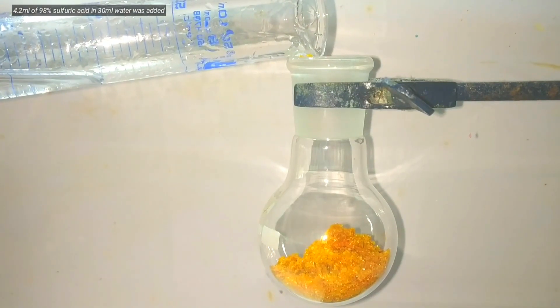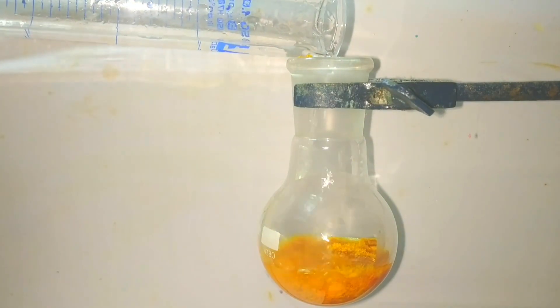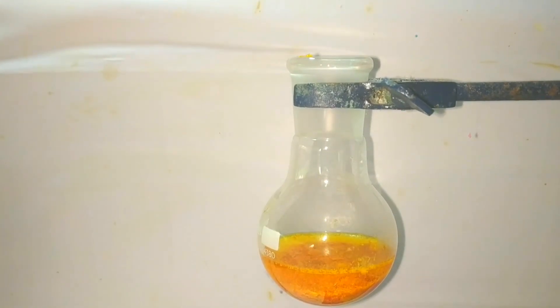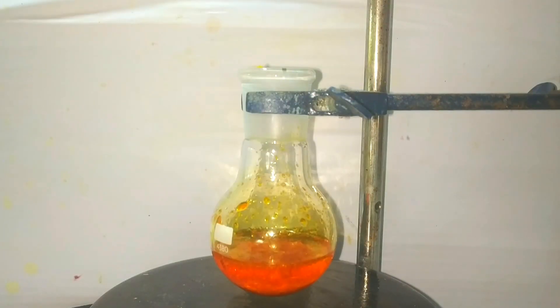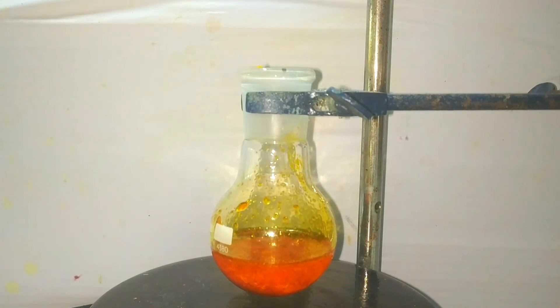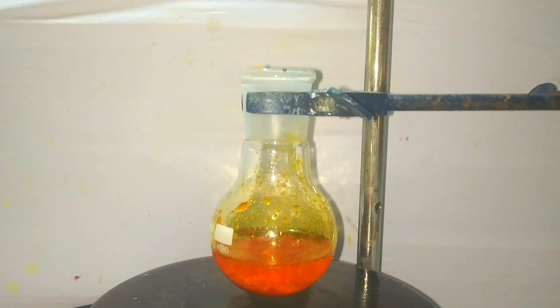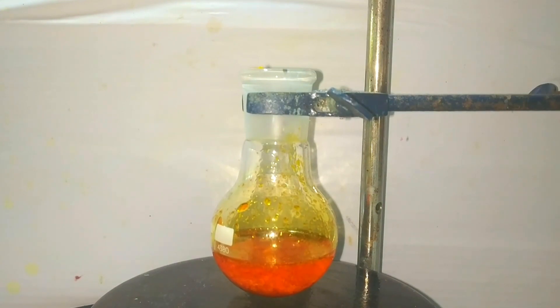Now add the sulfuric acid solution containing 4.2 milliliters of 98% sulfuric acid dissolved in 30 milliliters of distilled water. The dissolution of concentrated sulfuric acid in water is extremely exothermic, so be very careful in this step. Once you have added the sulfuric acid, place a magnetic stirring bar inside the flask and start stirring to dissolve the compound. It would take about 5 to 10 minutes to get a clear solution.